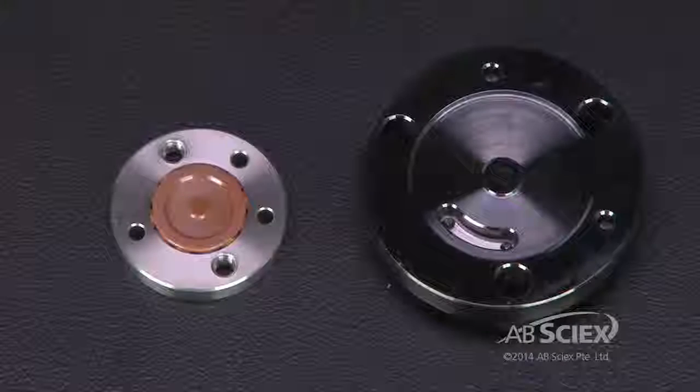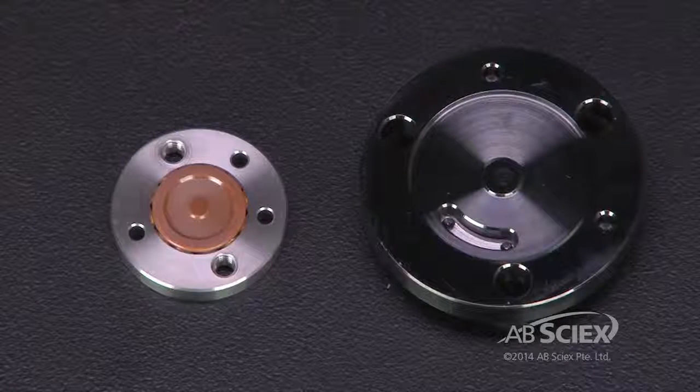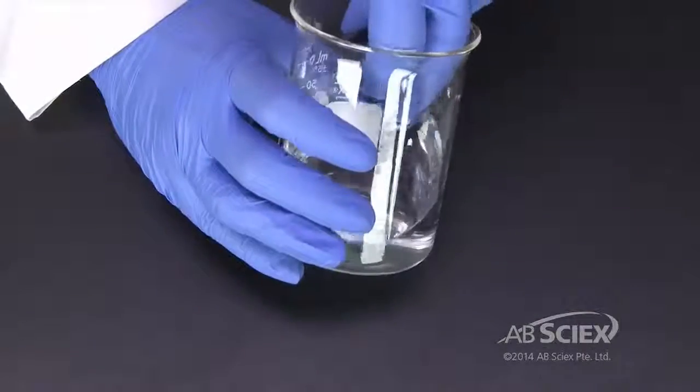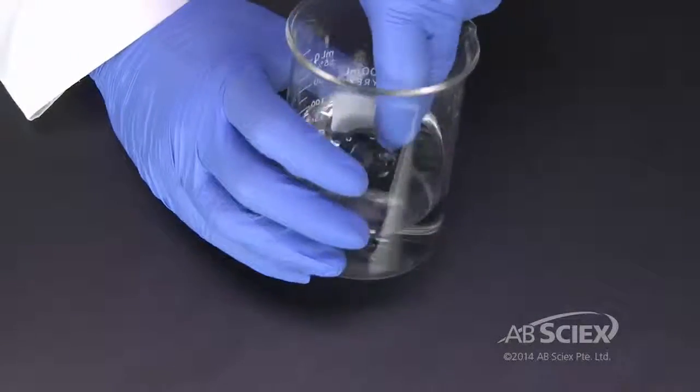Inspect the rotor seal and stator for damage or wear. Sonicate the stator in 100% methanol for 10 minutes with the sealing side facing up.